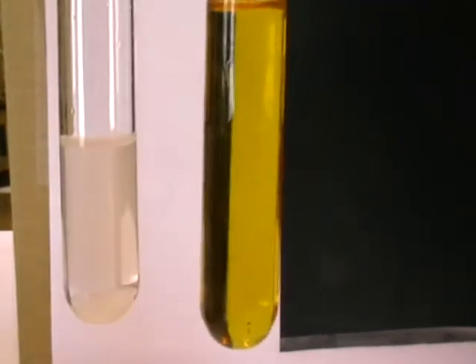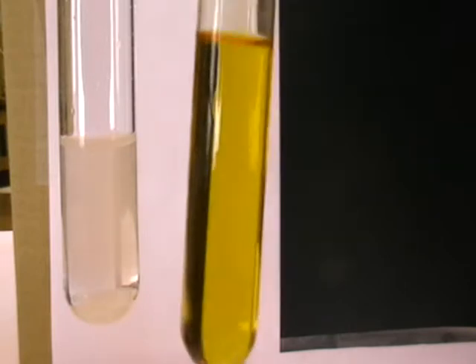So we have a colourless clear solution of sodium chloride on the left, and the orange brown solution of bromine on the right. We're going to see if bromine is capable of displacing chlorine.